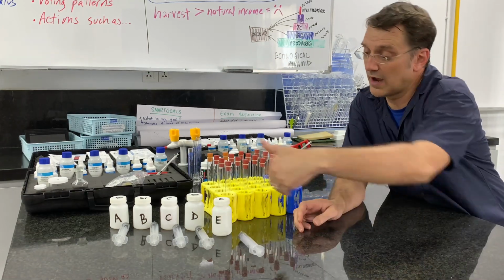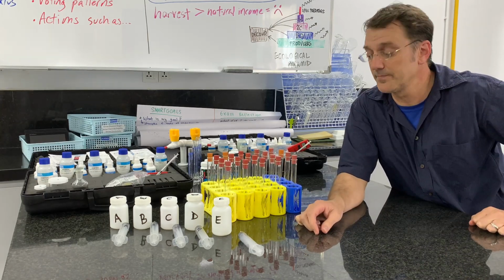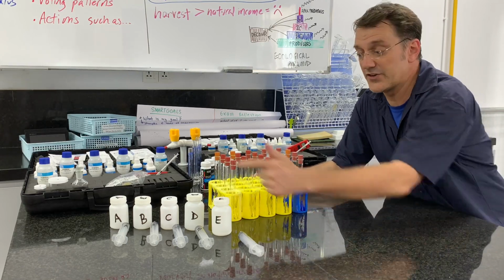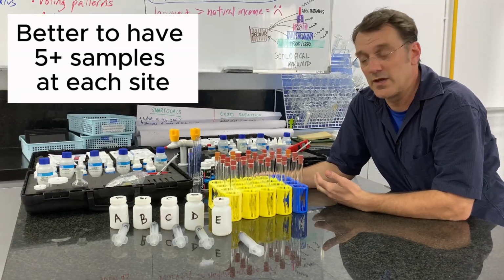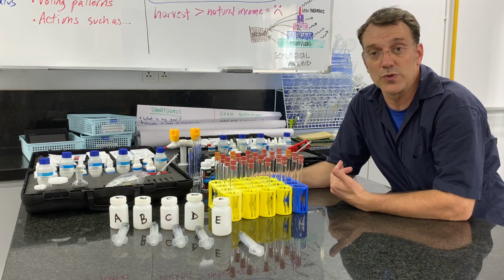Right? So I've got my 5 samples here, all with their individual pieces that they need. I've also got a test tube rack for each of those sites. And I'm going to take 4 samples at each one, or I'm going to run 4 trials at each one to check for consistency in my data. That should help ensure that I have data that is reliable.